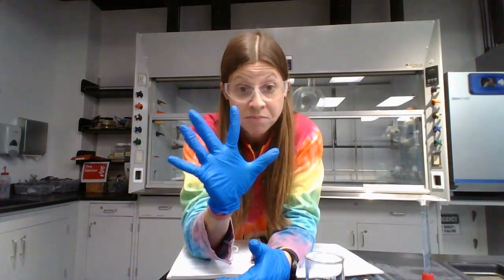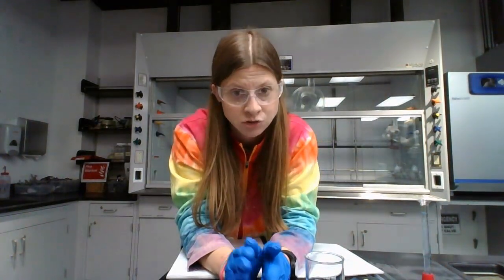So part A, there needs to be 5 standards made for your results to work. Unfortunately, the NMR instrument is pretty slow. So instead of having every group make 5 standards, those 5 standards are going to be split between 2 groups. So you're going to have a partner group situation going on where one group does 2 standards and one group does 3 standards, and you can fight over who gets to do the extra one.